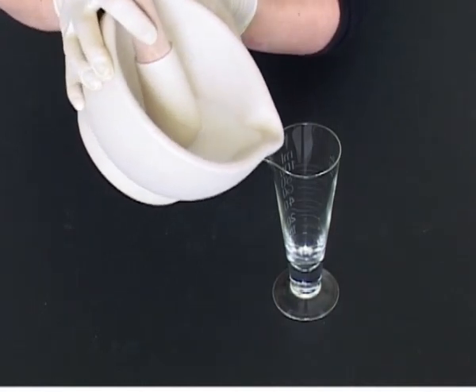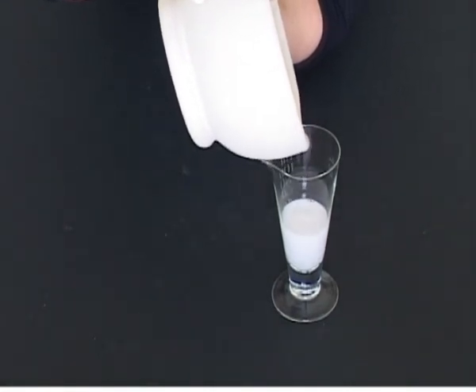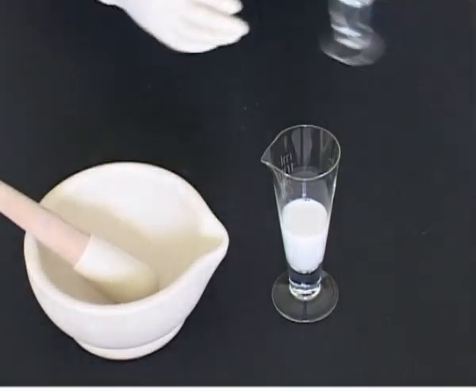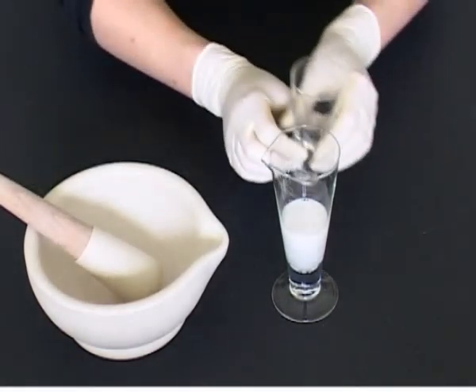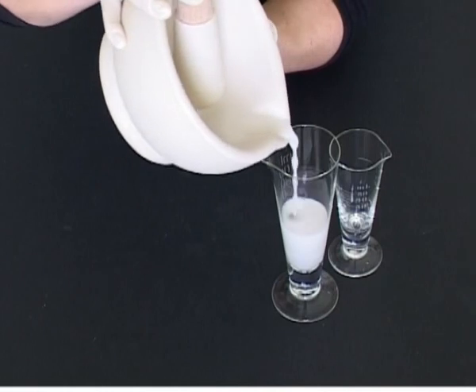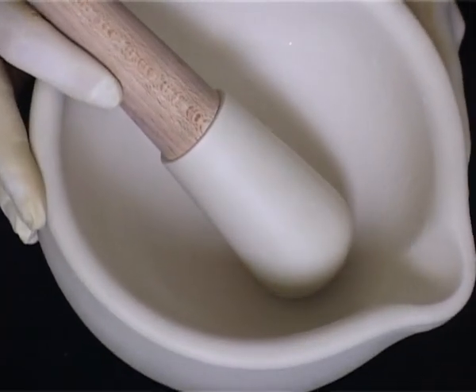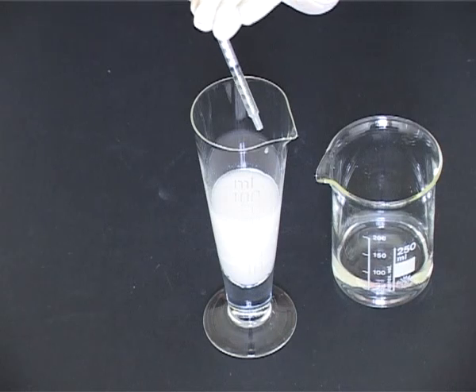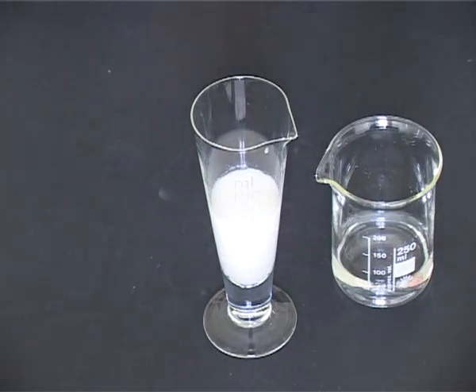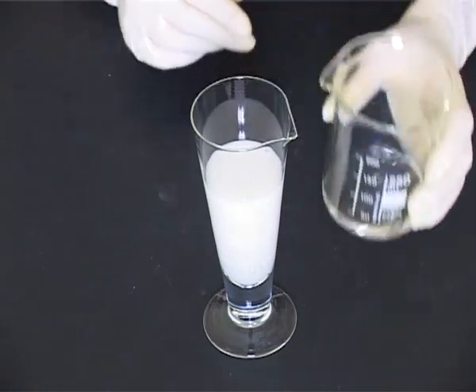Transfer the pourable paste into a suitable measure, and don't forget to rinse out the mortar with more vehicle. Ensure no paste is left behind in the mortar. Add any liquid ingredients. Make up to volume with more vehicle.